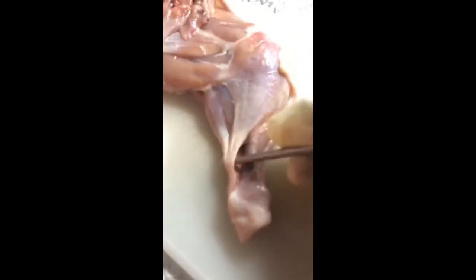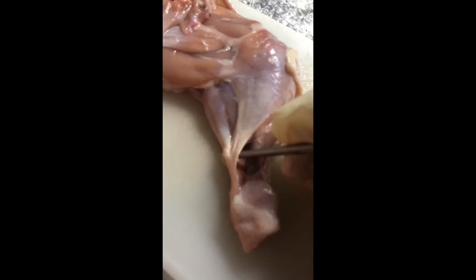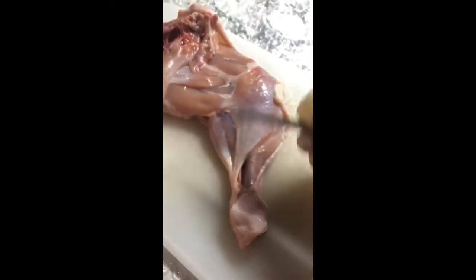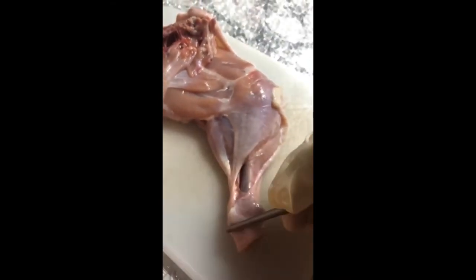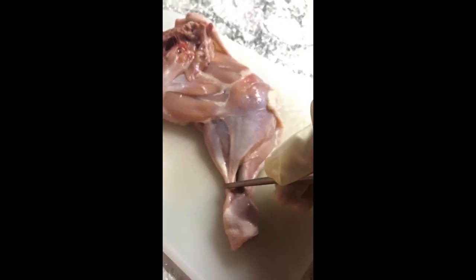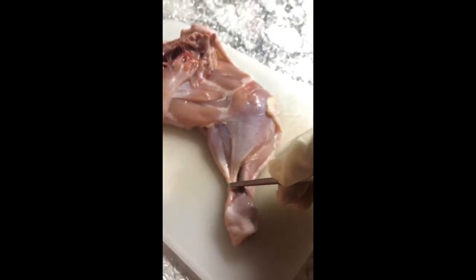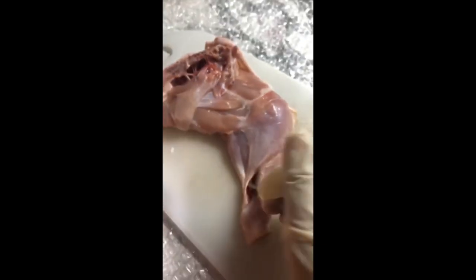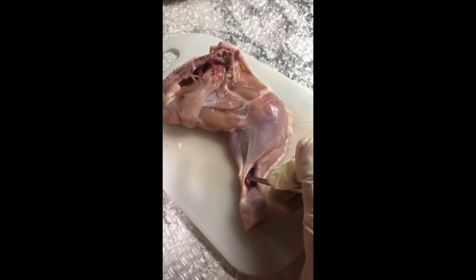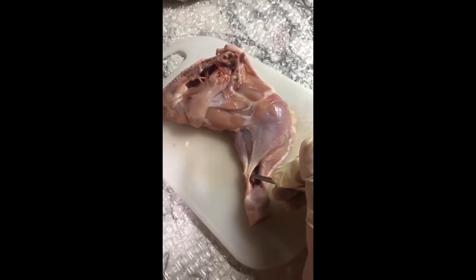These tendons, just like those found in our body, connect the muscle to bone and actually allow them to move together. Without these muscles, our body would not be able to move — they rely on one another and work together.